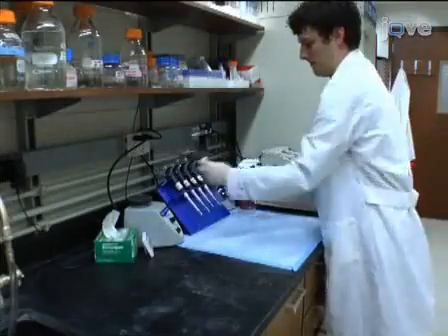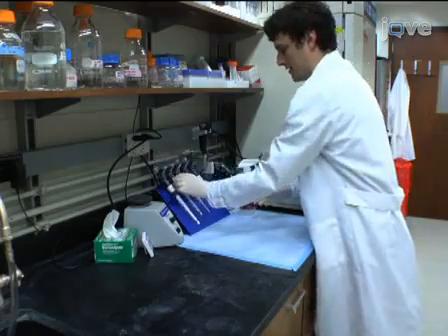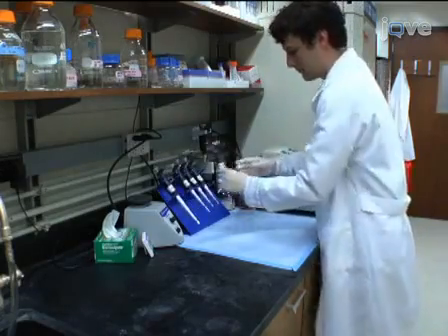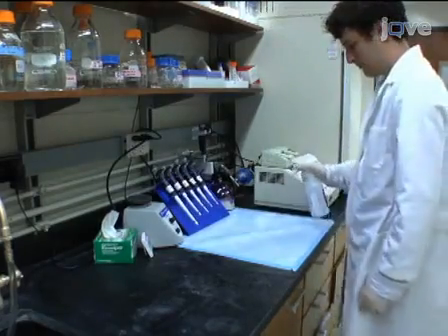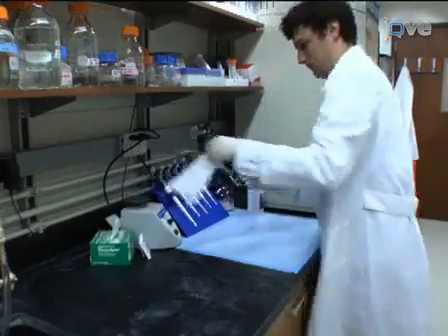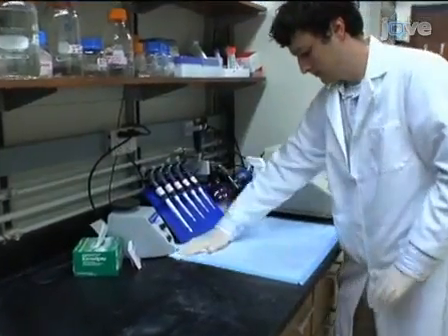When working with RNA, it is very important to work in an environment that is free of RNases. Use simple precautions such as having reserved pipettes for use only with RNA procedures and spraying the work area with RNase away before starting extraction of total RNA.